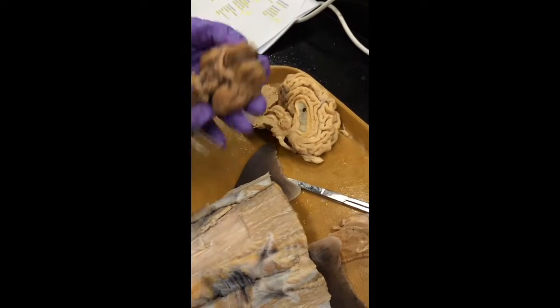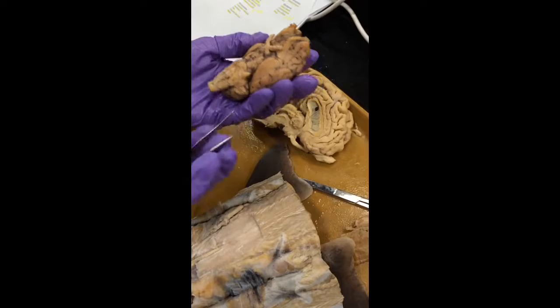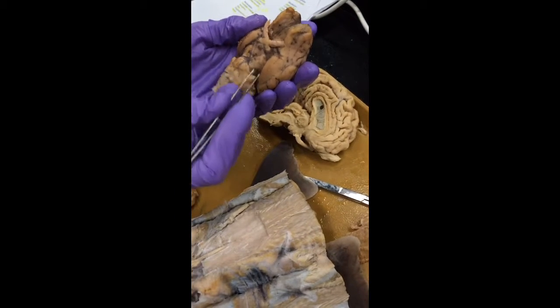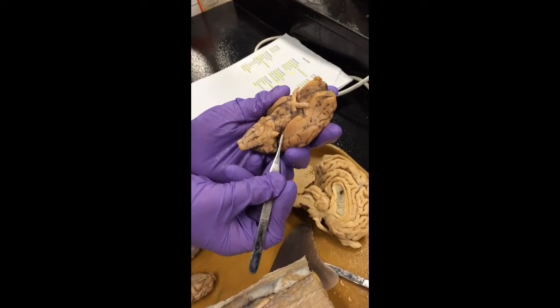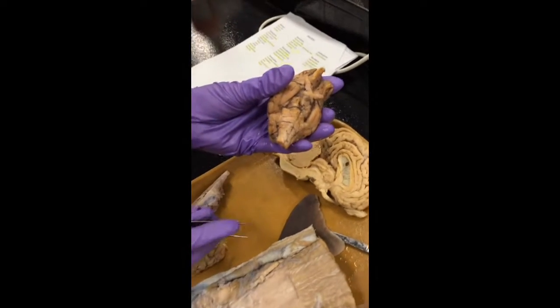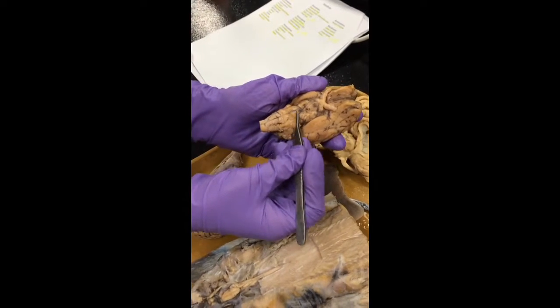The rest of our nerves. So we had our optic nerve up here, our trigeminal nerve, the big old thick one on either side here, our oculomotor right here in the middle. I think this one's missing. And the trochlear nerve is a smaller nerve coming out right here. So kind of look in between the two hemispheres there. Trochlear nerve coming out either side. You have the spinal cord, the medulla oblongata, and then the pons, the rounder kind of portion right there.